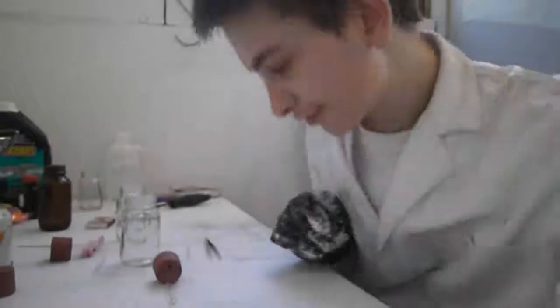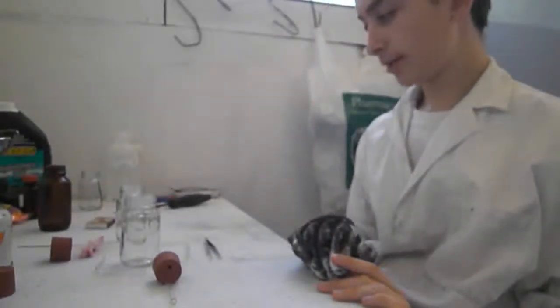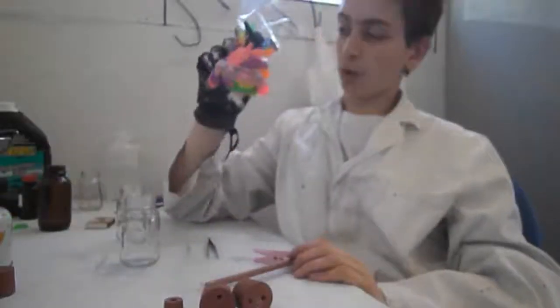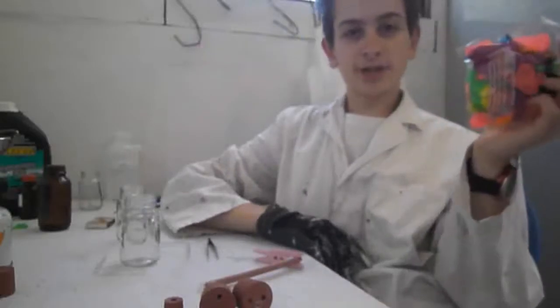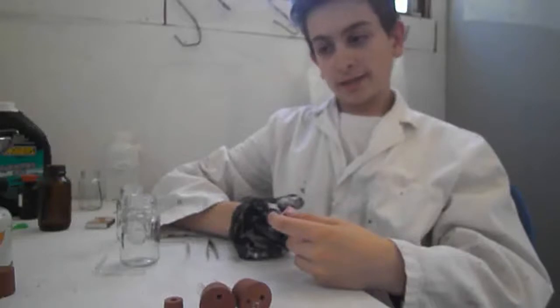Okay, so, finally, after lots of rod breaking and pain, I managed to bore some holes into the stoppers and shove some glass tubes through. I found these water balloons and I had an idea of actually filling some of them with the hydrogen gas, making it explode, because that would be fun. I guess I'll try and assemble it now and I'll let you know when I've finished assembling the gas generator.